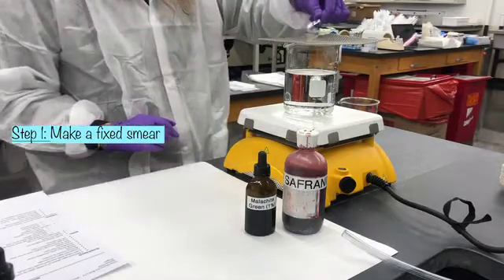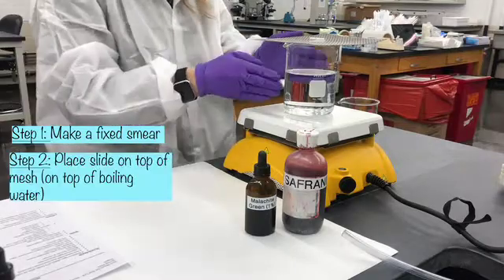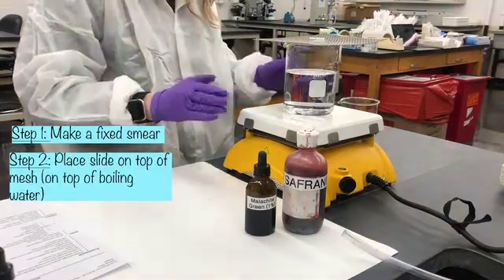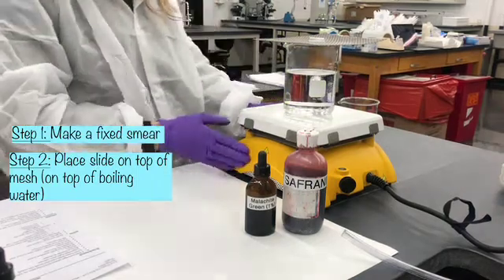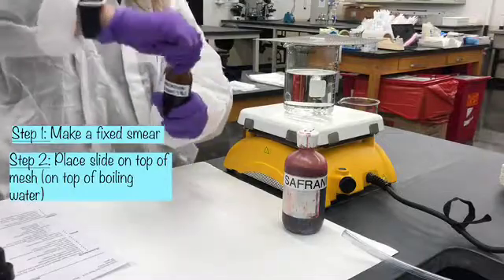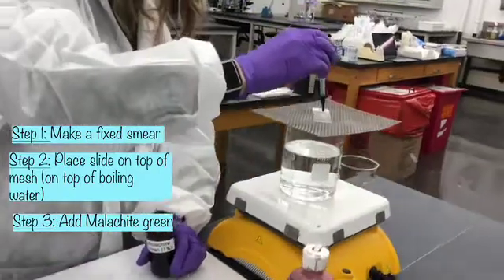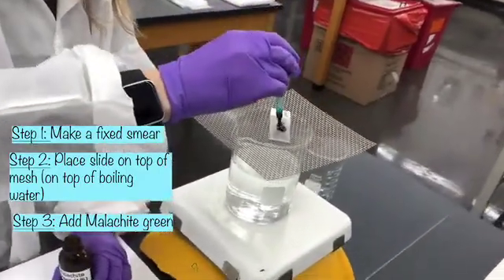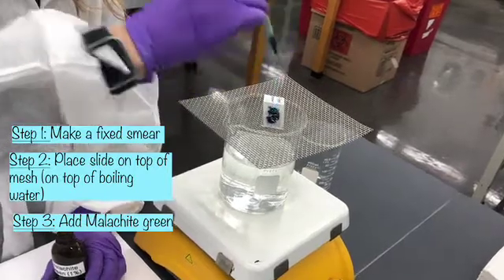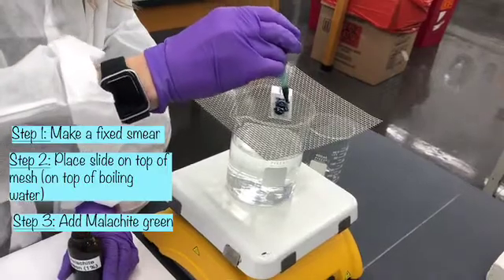For this technique, we want to determine whether we can visualize endospores. So we're going to make use of this boiling water or close to boiling water, as well as this heat station. And our first step is going to add malachite green. So malachite green is this really robust green stain. It's a direct stain, so remember it's basic, positively charged.